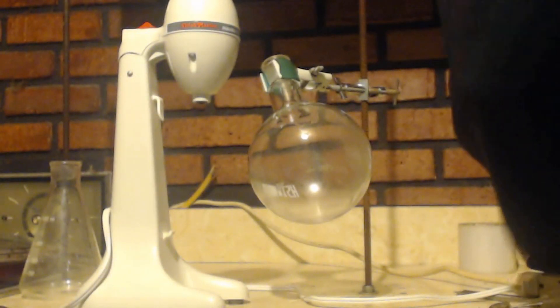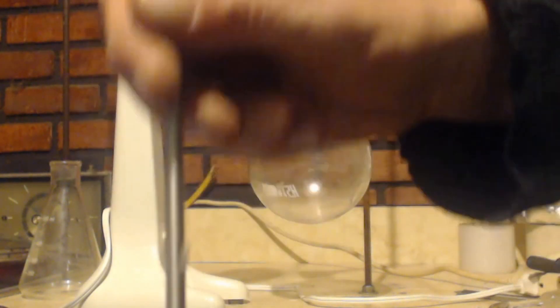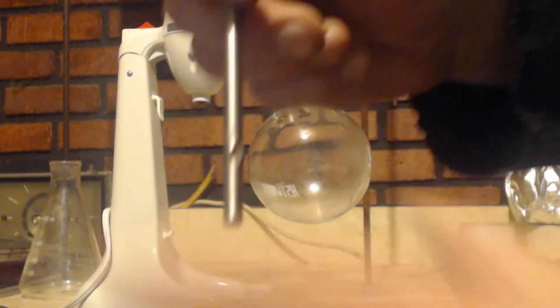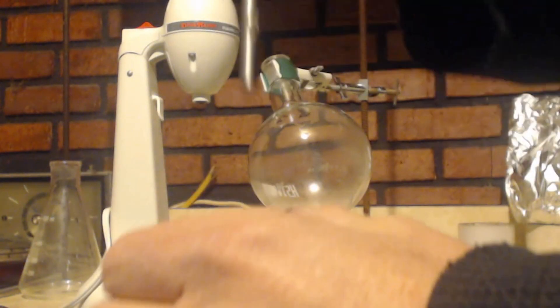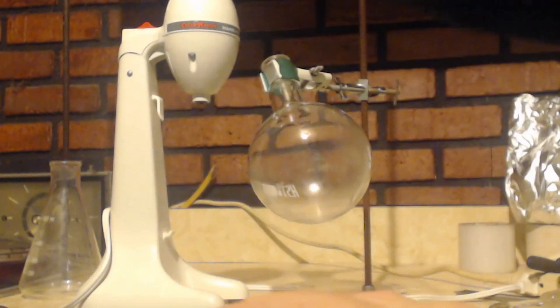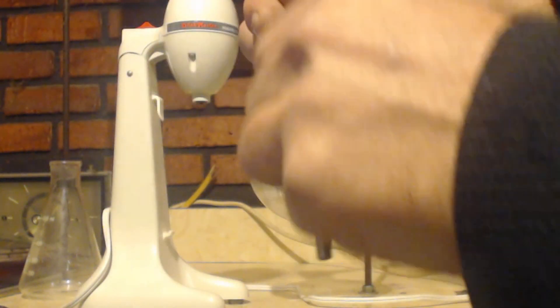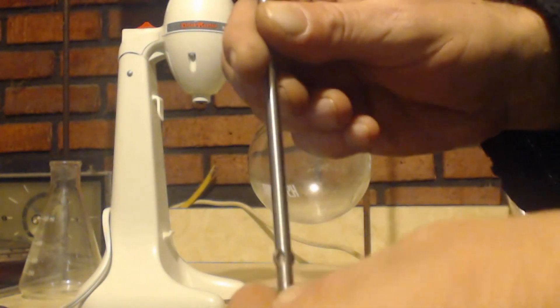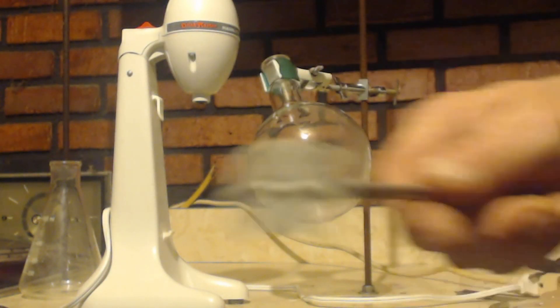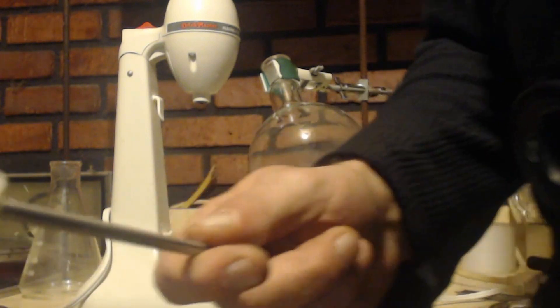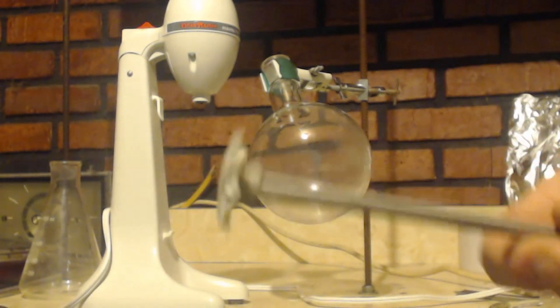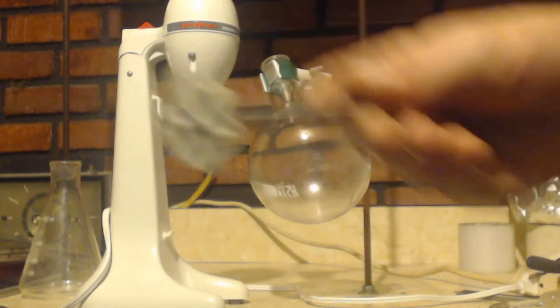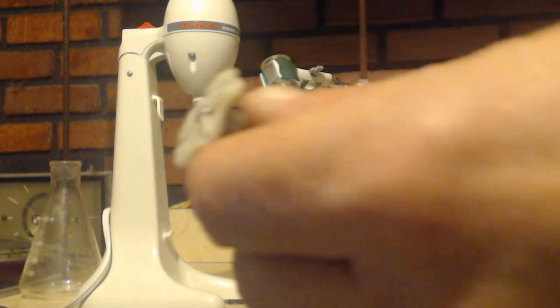But they have a can that you can buy and you just dip this into the can. You open the can, there's liquid stuff in there, you dip it in and then you let it dry and it'll put a coating of something on it.